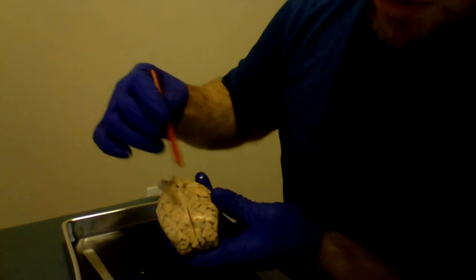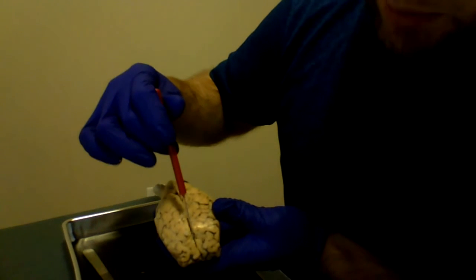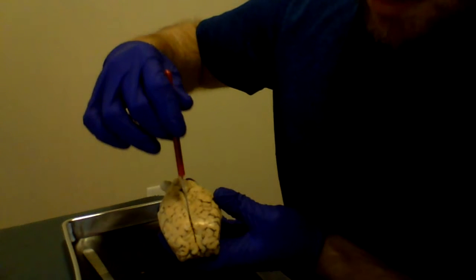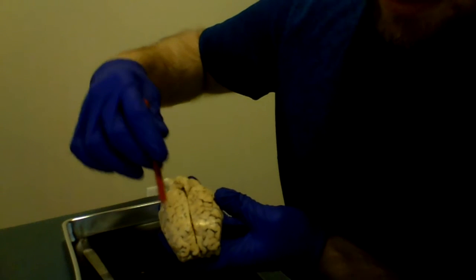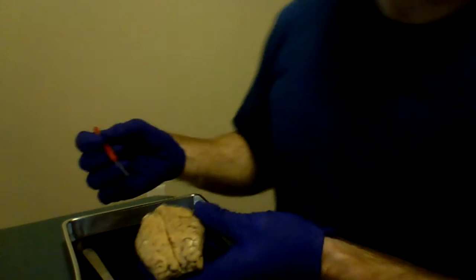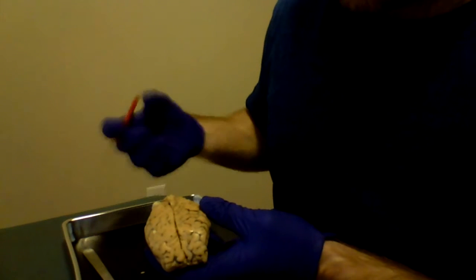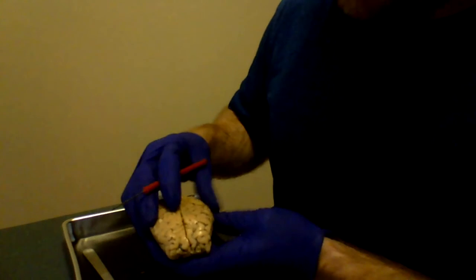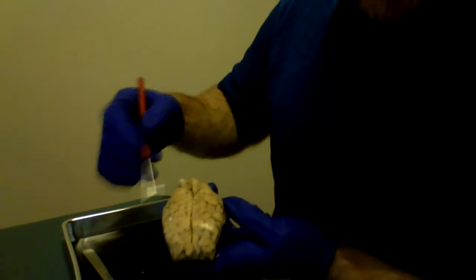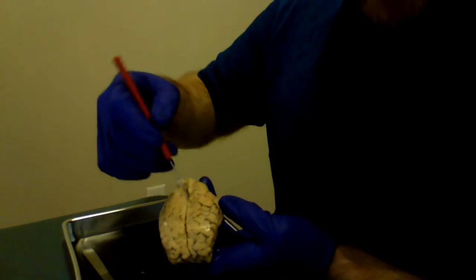Of course, your brain without the scalpel incision is separated by the longitudinal fissure, and this area which is separated by the longitudinal fissure is the cerebrum. Now in the video, she did not talk about a central or lateral sulcus, but I did some research there. We're talking about a very large valley.